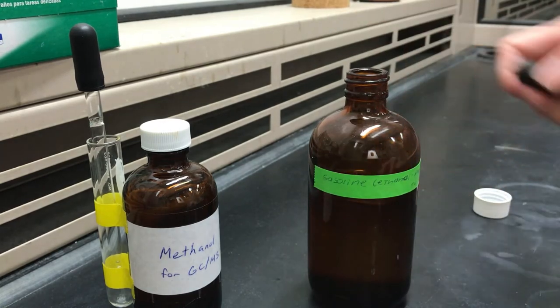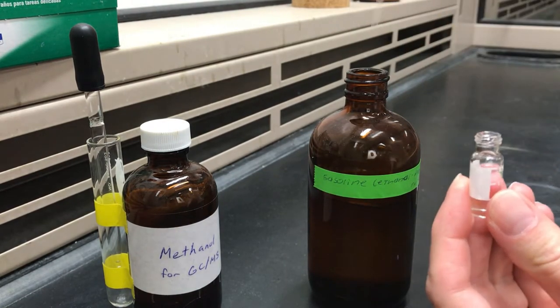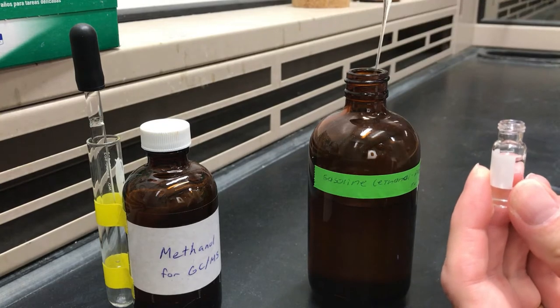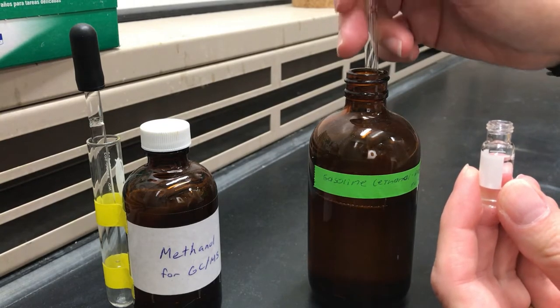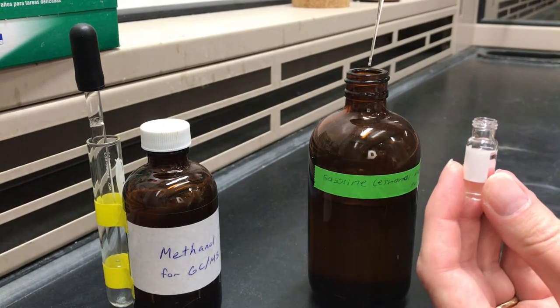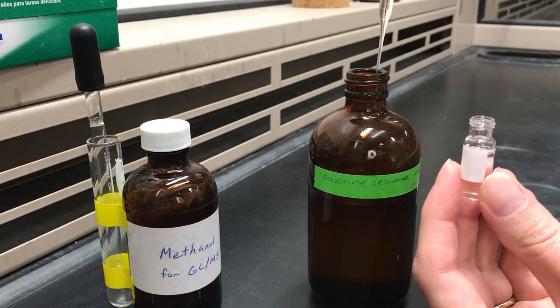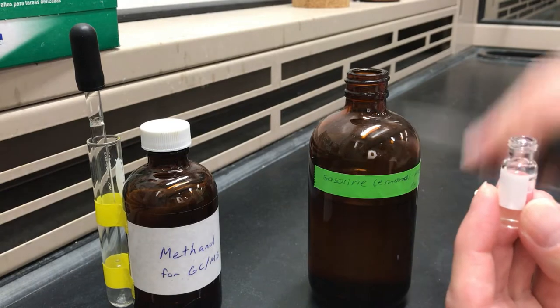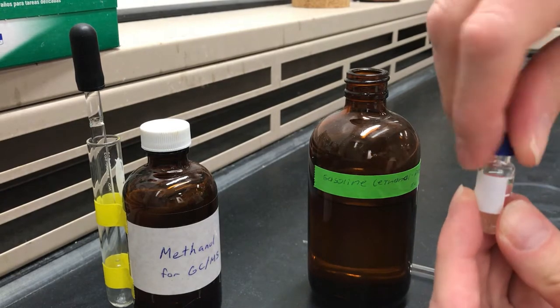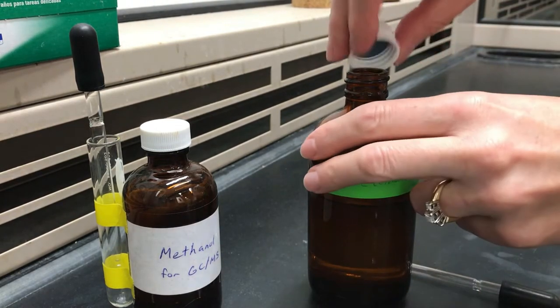Here I'm going to analyze gasoline. GCs have to be run on very dilute samples so really one drop is plenty. Sometimes you'll feel like you're not sure if you actually added a drop. You did. It's enough. It has to be very dilute and then the machine actually even dilutes it further.